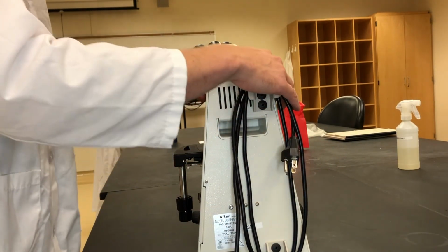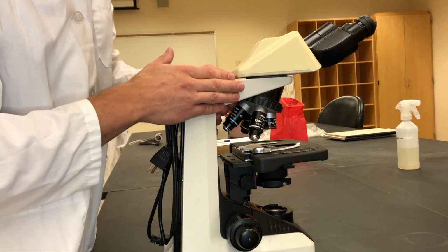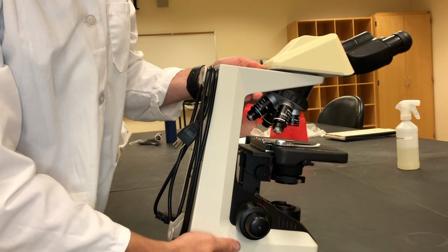If you guys have any questions today, please let me know. Be happy to answer them. Also, when we lift this up, we're going to make sure we grab it by the arm and the base.